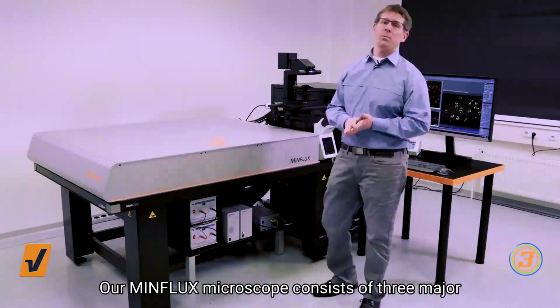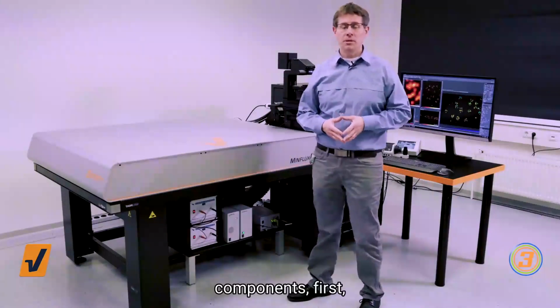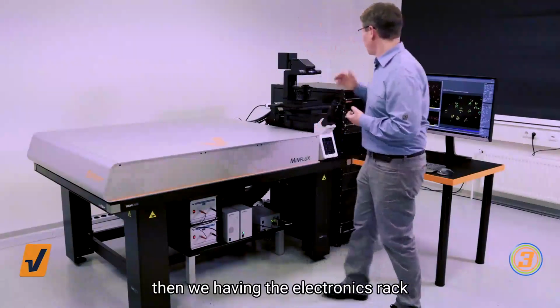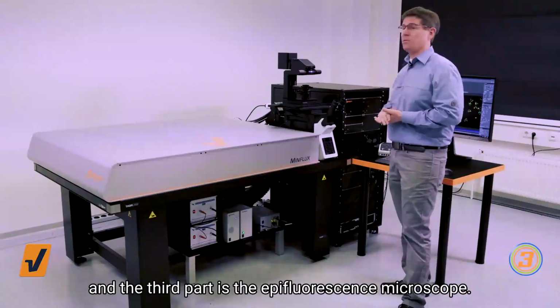Our MINFLUX microscope consists of three major components. First, the optics enclosure here, then we're having the electronics rack, and the third part is the epifluorescence microscope.